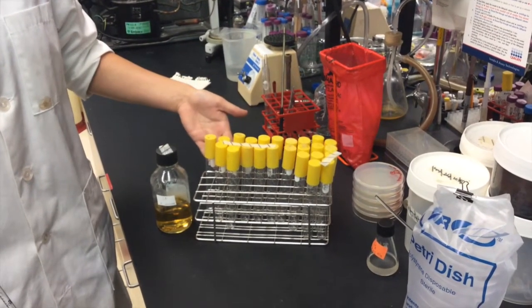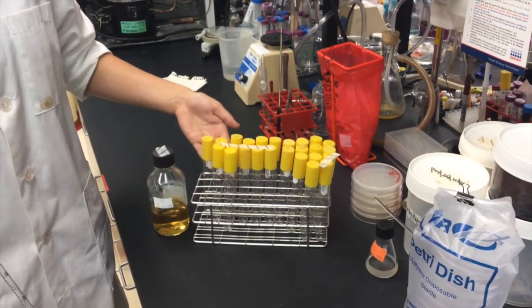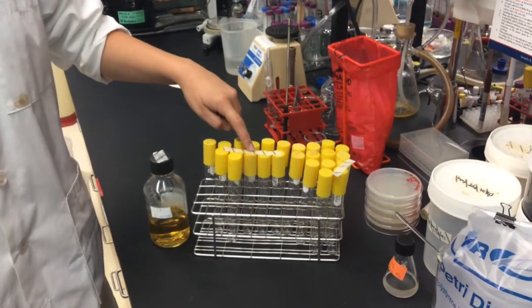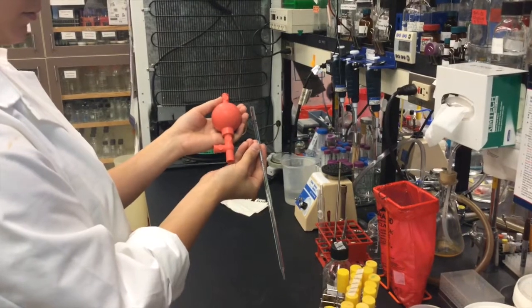These tubes have been sterilized. We know this because they have been sealed and marked with tape with black markings.